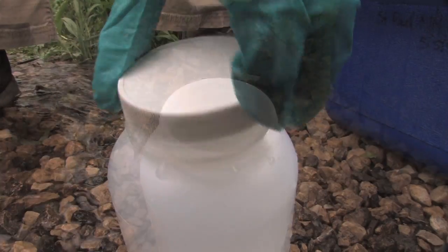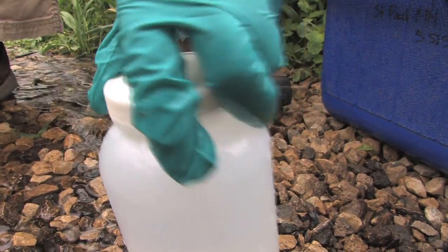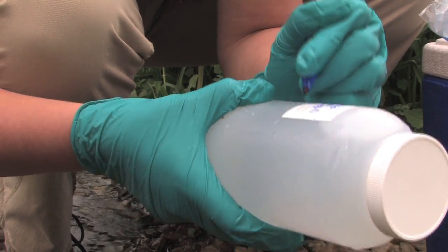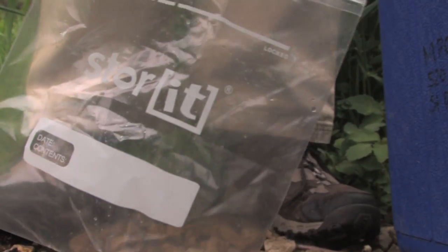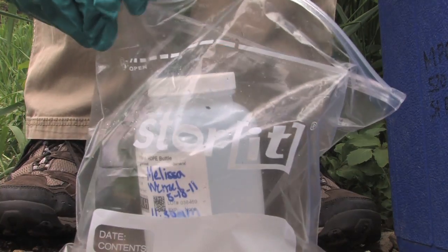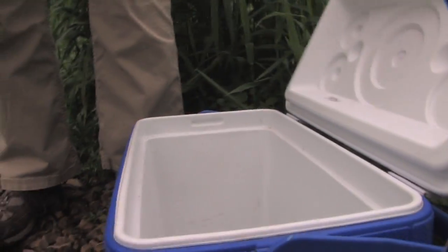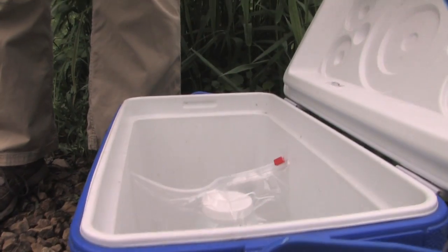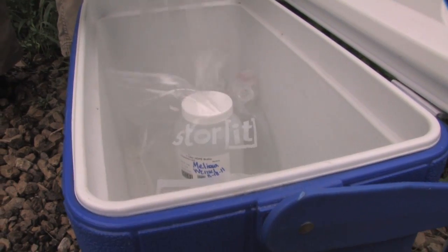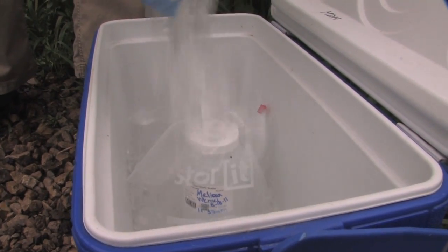Cap the sample bottle, then record the time the sample was collected. Place the samples inside a resealable plastic bag before placing the bottles into the cooler. Place the bag into a cooler and prepare the cooler according to lab instructions for pickup or shipment to the lab. Often, labs require that the samples be packed in ice to help preserve the sample.